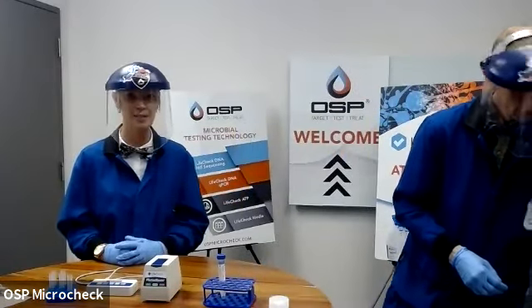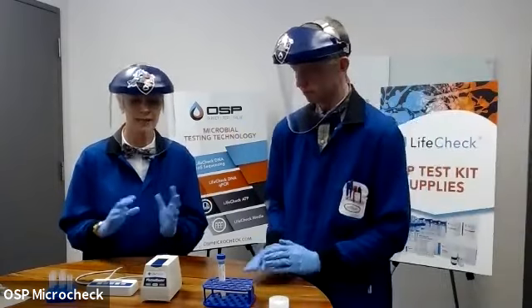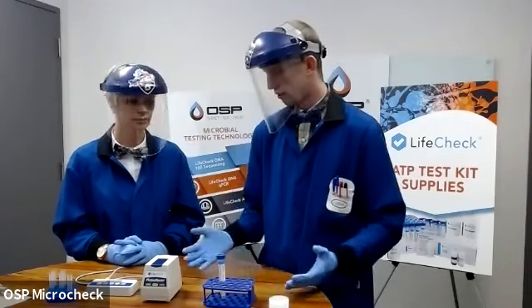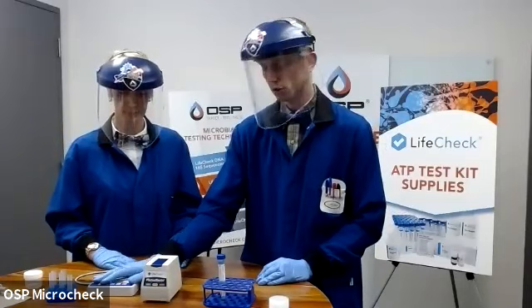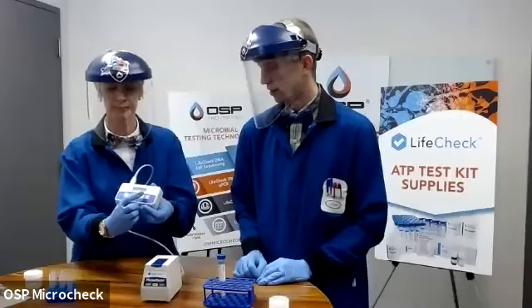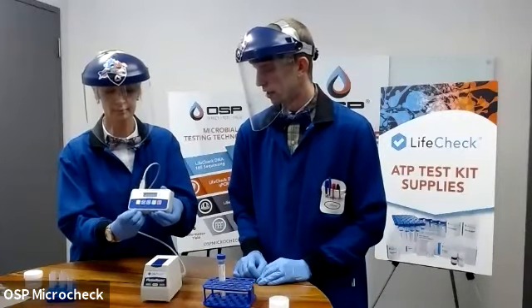You can keep that enzyme in the fridge in between doing testing rounds, and it'll stay for quite a long time. All right, so I think we're ready to get on to our standards testing. So the first thing we're going to do is turn on our luminometer. That's the yellow button on the left. It'll take a few minutes to turn on.